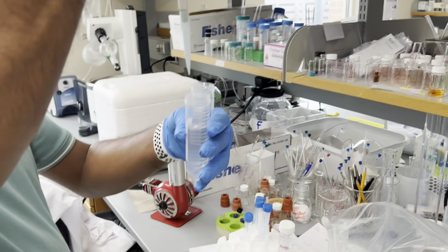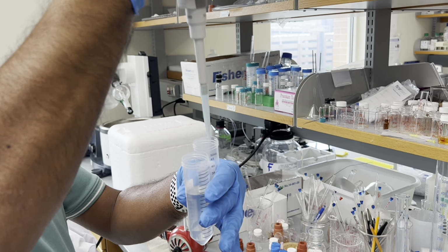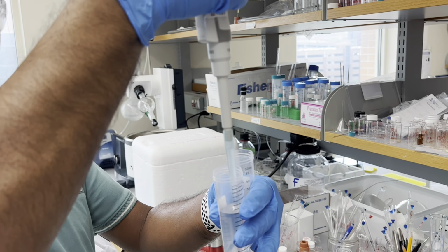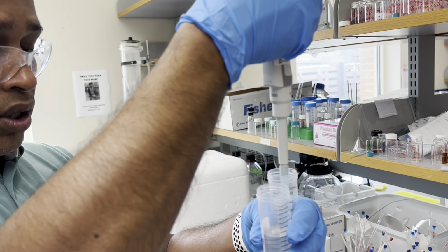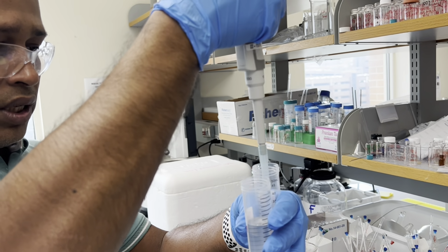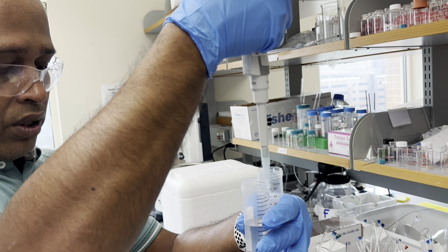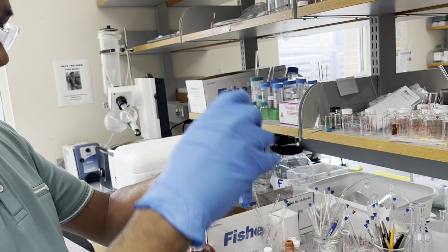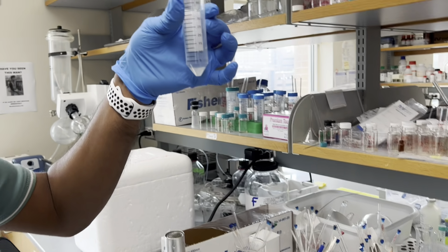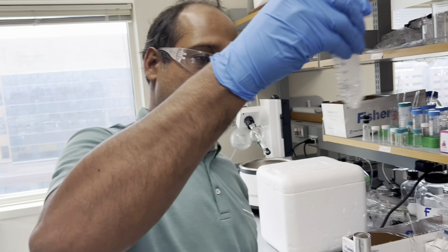And we want to be as precise as possible, right? Yeah, definitely. For a buffer solution, even if it is a little bit rough, it's fine, because the pH is the target. The pH will not be changed. 2, 3 and 4. Done. The total volume will be around 5. If you make a mistake, like forget how much you added, you can't shake it loose; it changes the concentration.